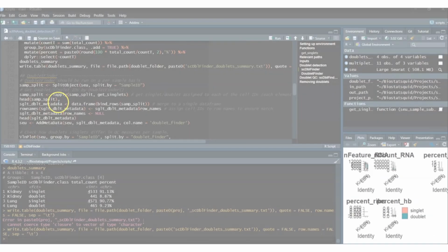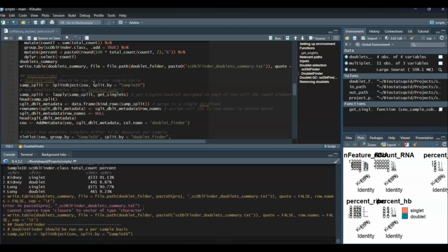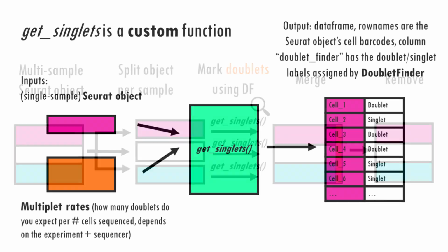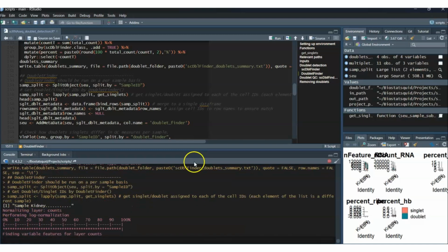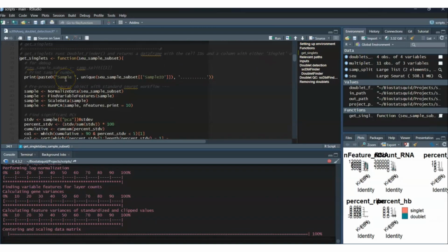Easy. So first, let's split our object. Next, we will apply get singlets, which I mentioned in the first tutorial. Get singlets is a custom function I created to run all the different DoubletFinder steps on each of the samples. So if your original Seurat object had 5 samples, the split function will return a list of 5 objects, and you would run get singlets on each of the elements of your list. So basically per sample. My custom function does quite a few things, but we will go through it step by step. Let's run it because it takes a while, and meanwhile I'll explain what it's doing.